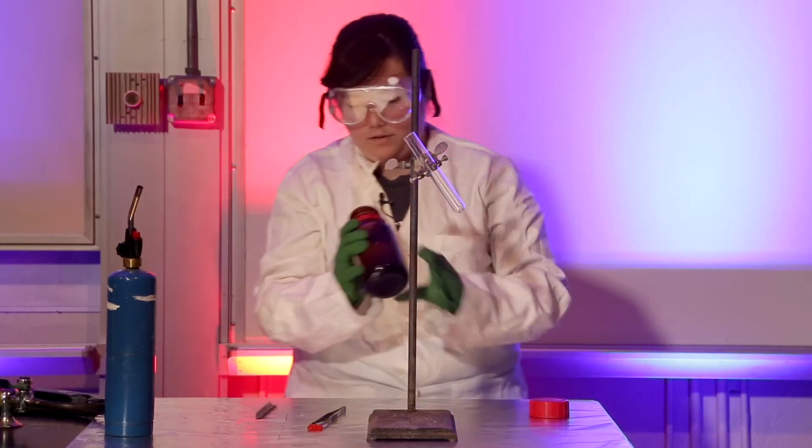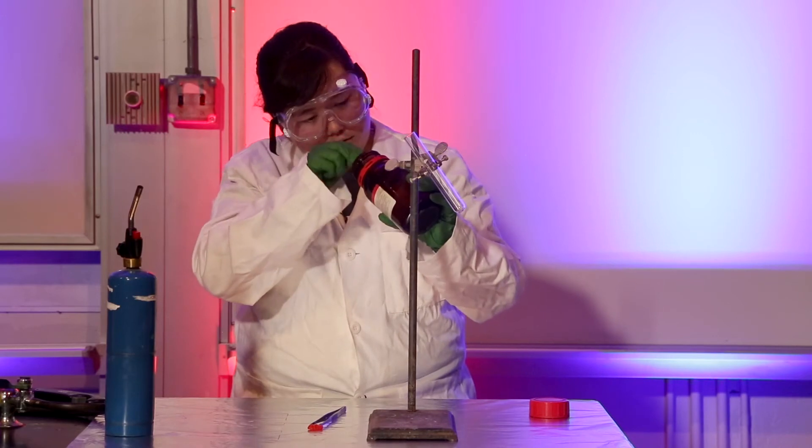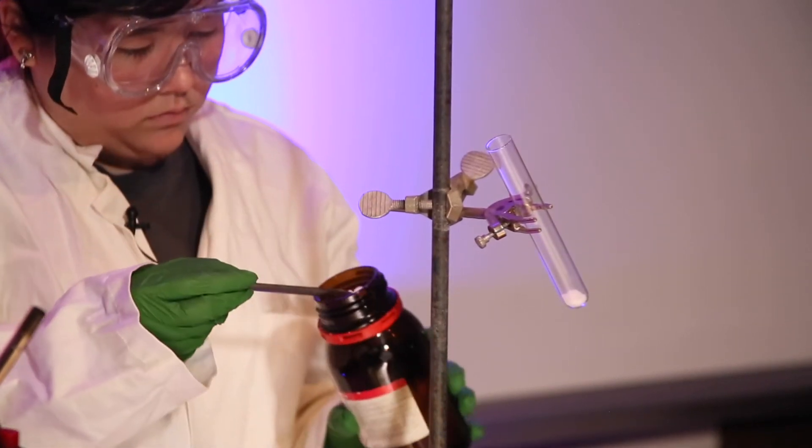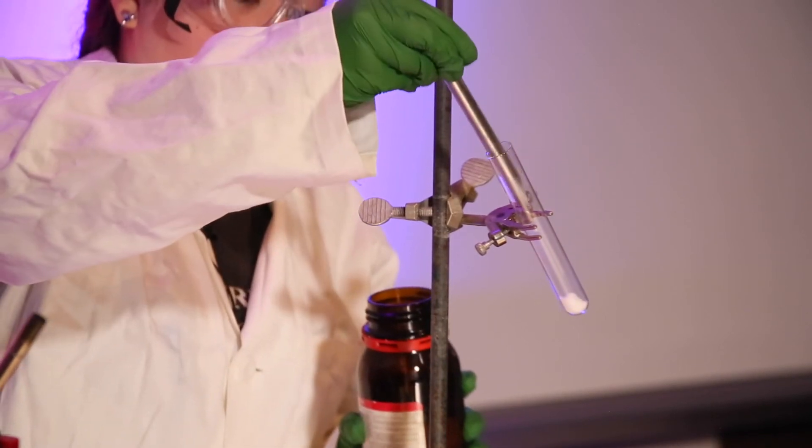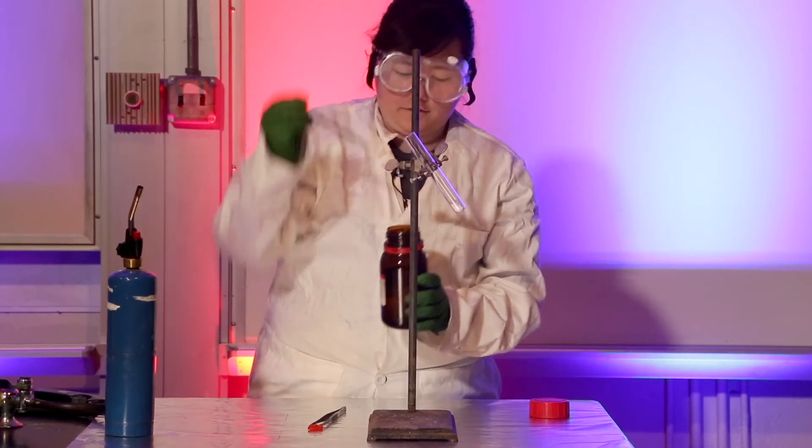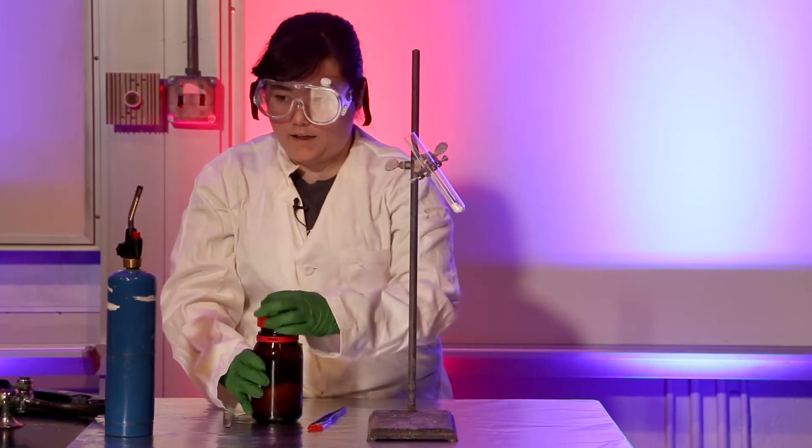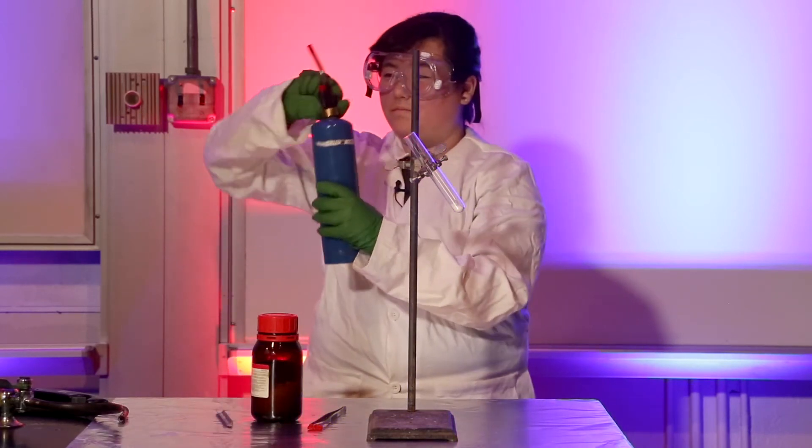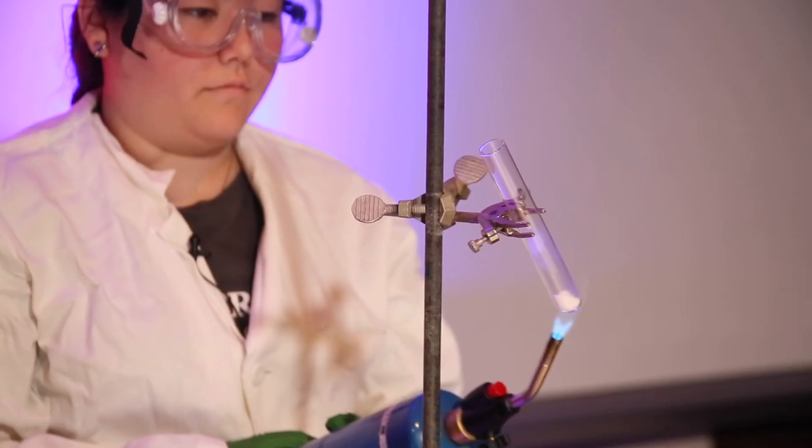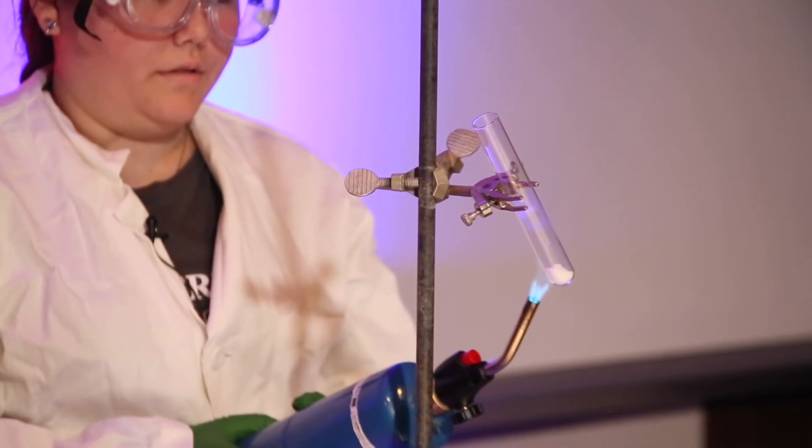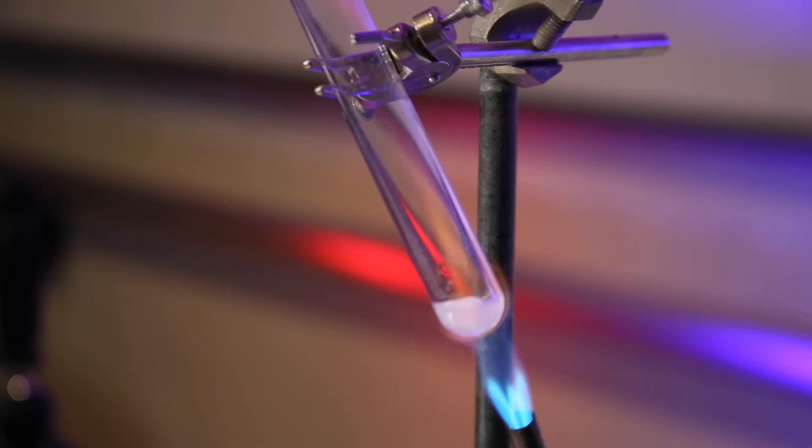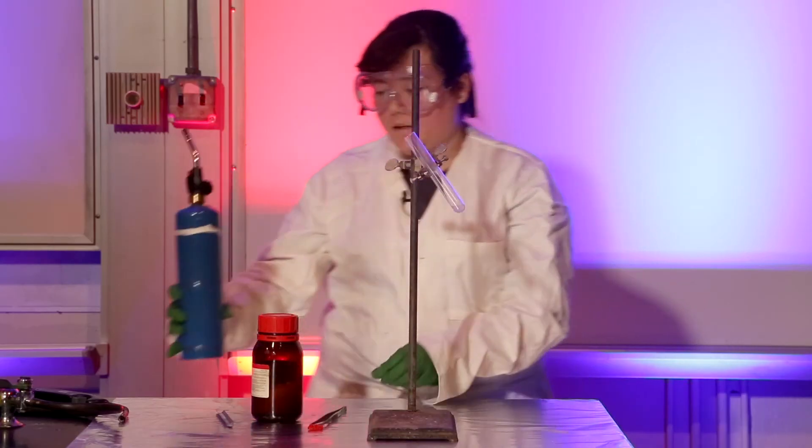Next up we are going to heat it up with our torch. We're going to heat it up until it's about to a boil. And next we shall drop in our gummy bear.